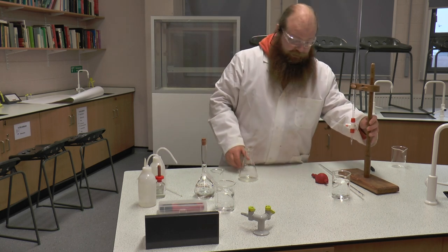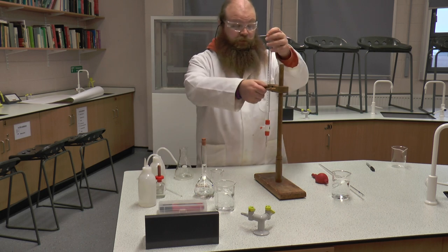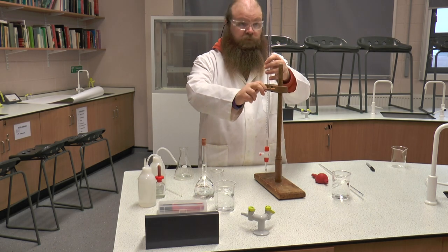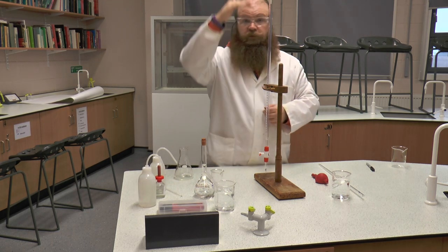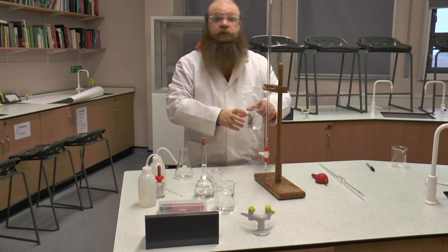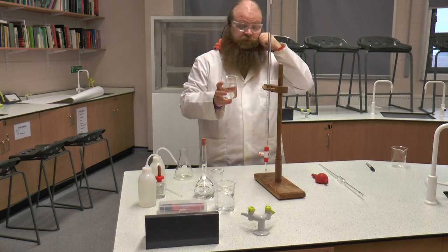To do this we're going to put hydrochloric acid into our burette. This needs to be done in such a way that you are not working too high above eye level for your own safety. Now we're using a funnel into our burette.